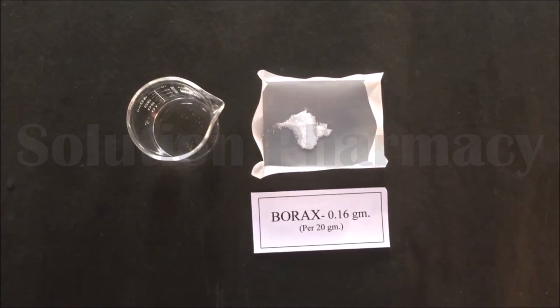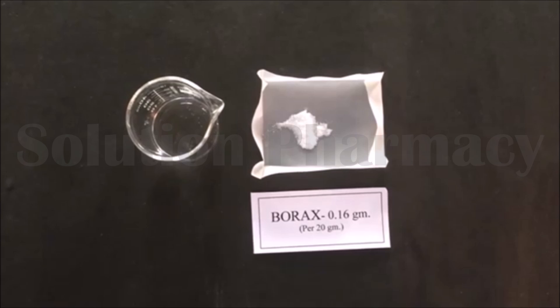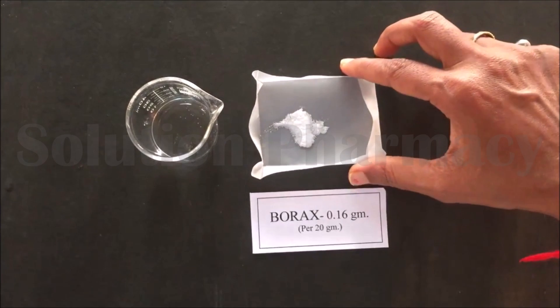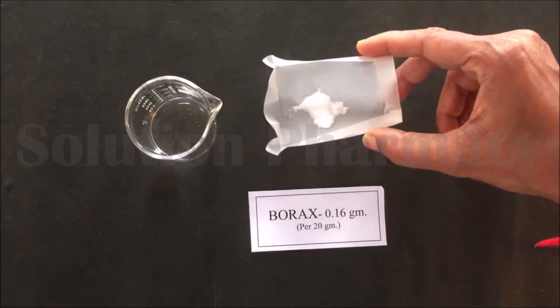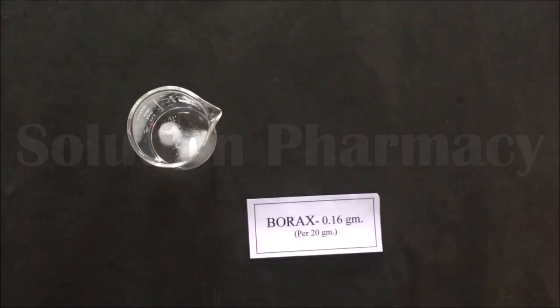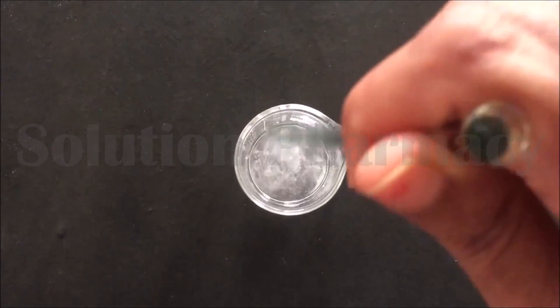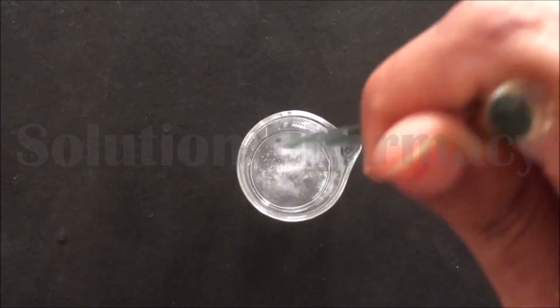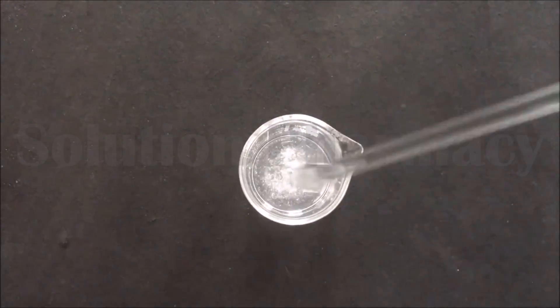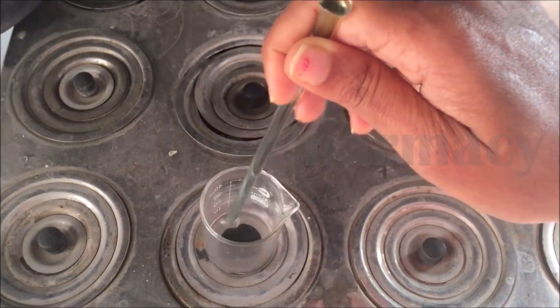Next we have to prepare the solution of borax. We have already weighed 0.16 grams of borax — transfer it into a small beaker containing 6 ml of water and stir with a glass rod to dissolve it. Here you can see that borax does not dissolve in water at normal room temperature, so we have to heat the contents of the beaker to dissolve the borax. Borax is now completely dissolved in water.